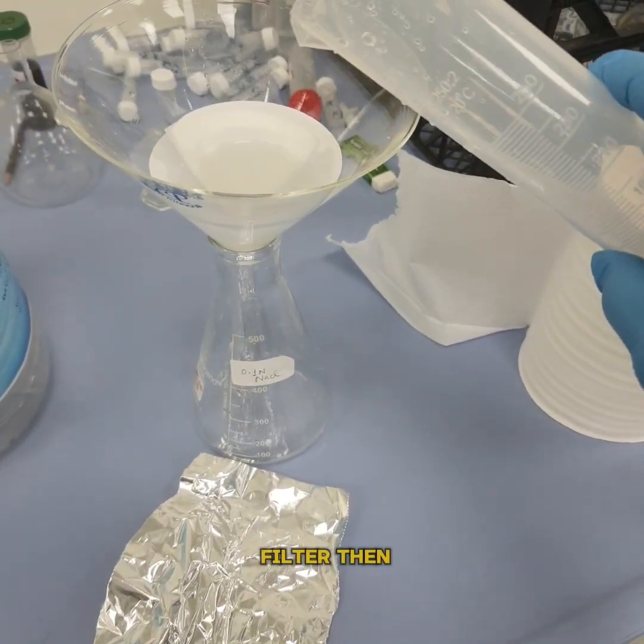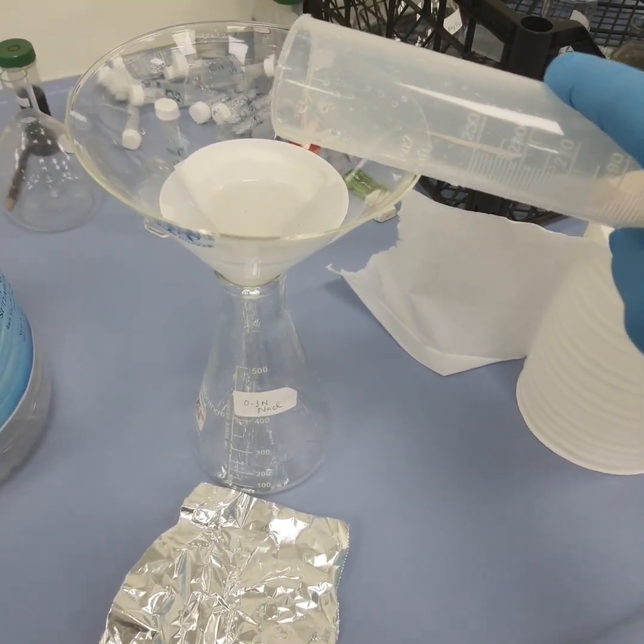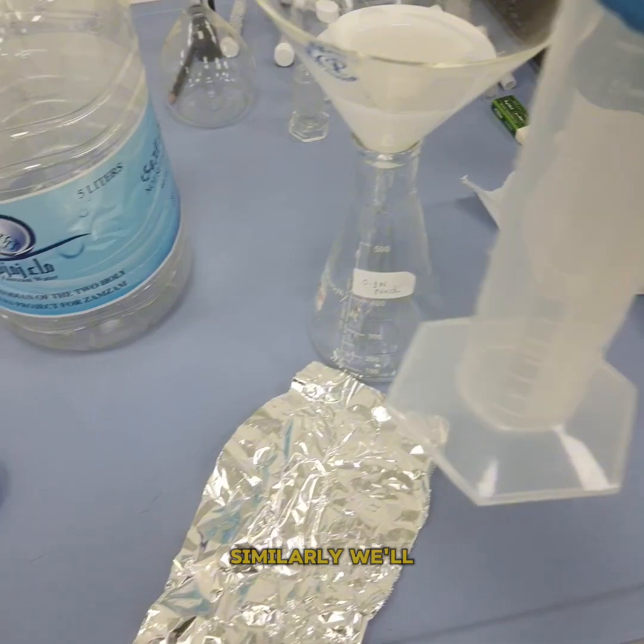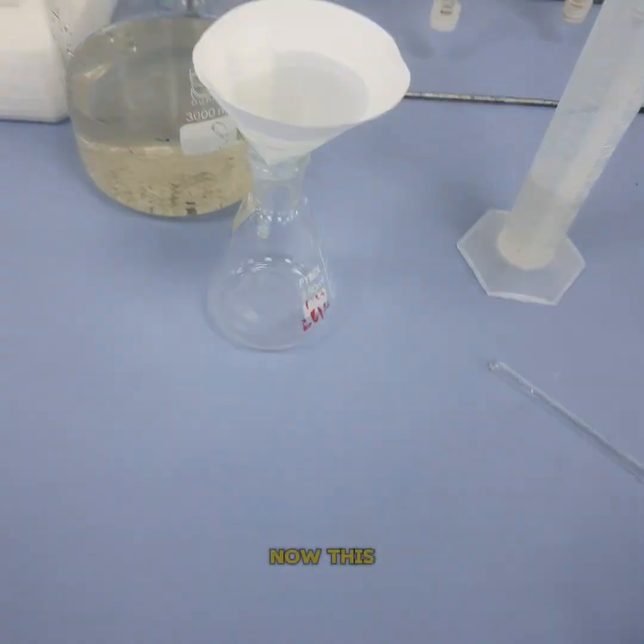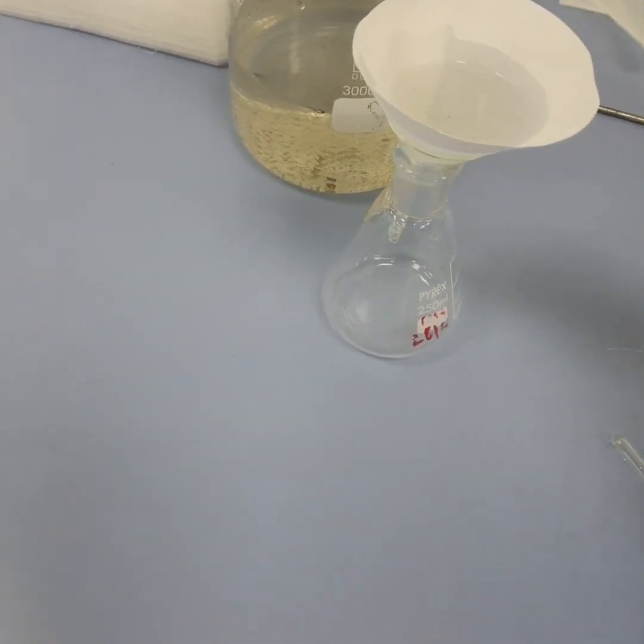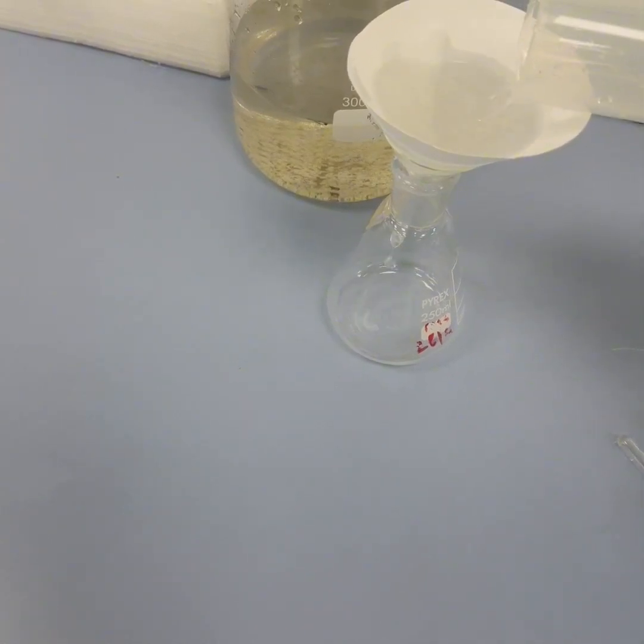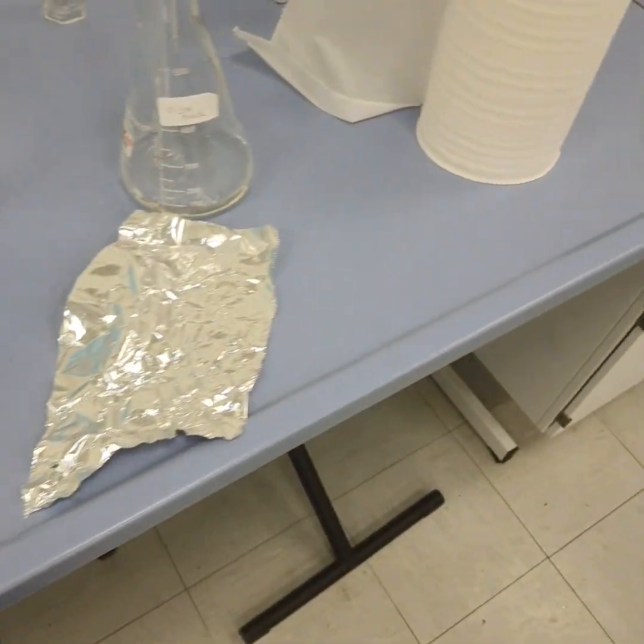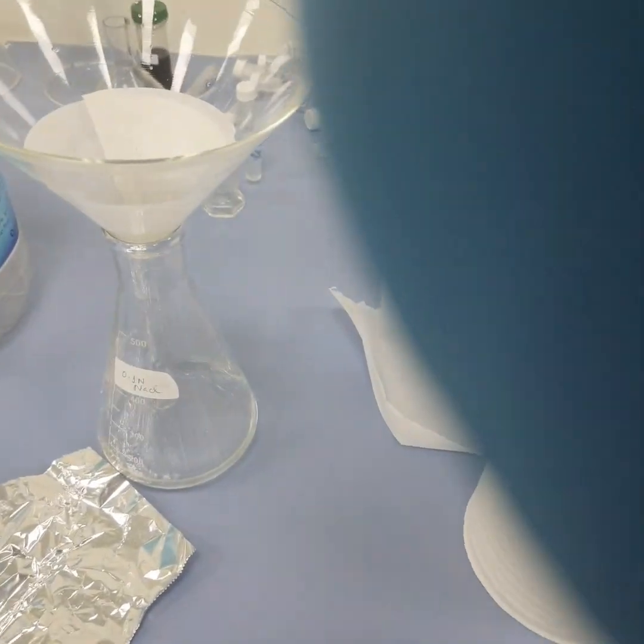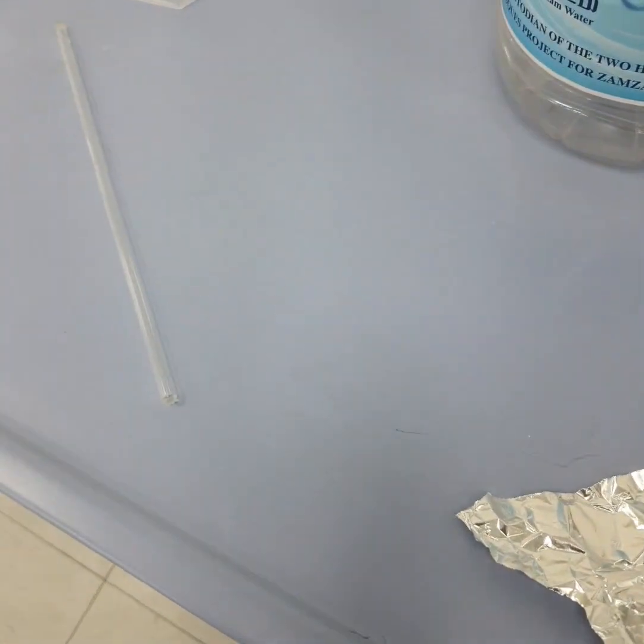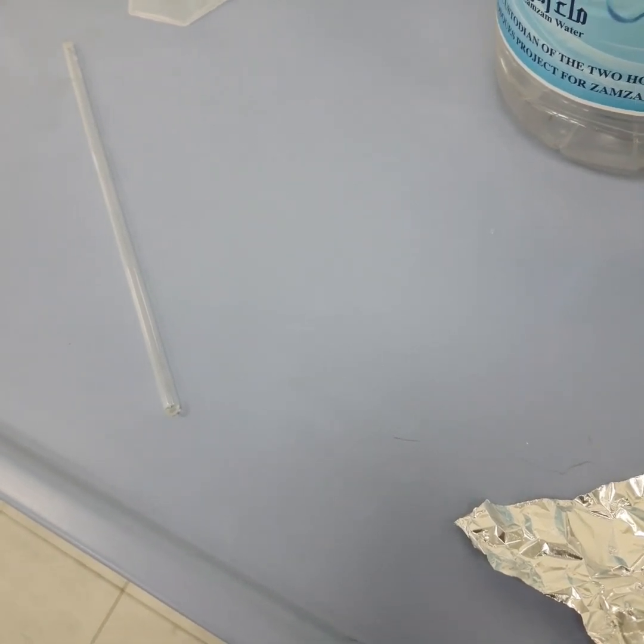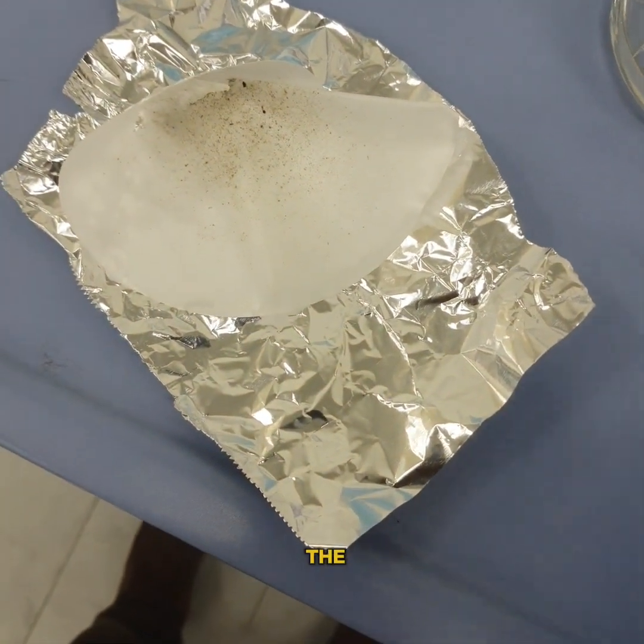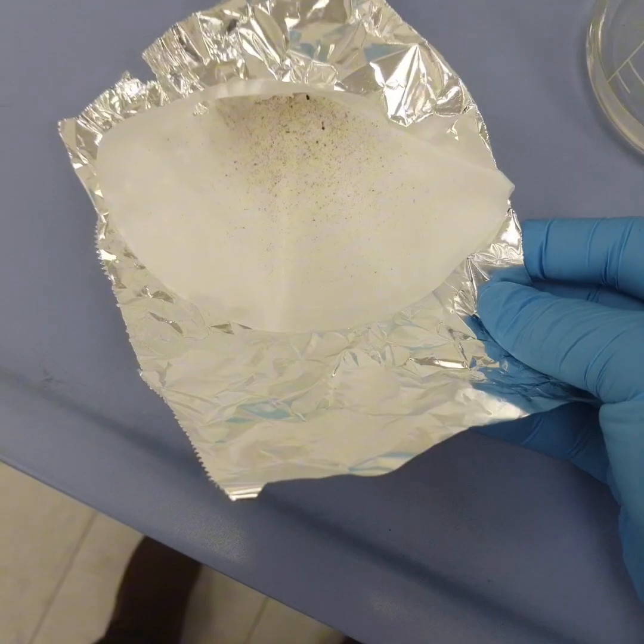We will wait for it to filter, then we will dry it. Similarly, we will take another sample here. Now this is my second sample. So this is the filtered part.